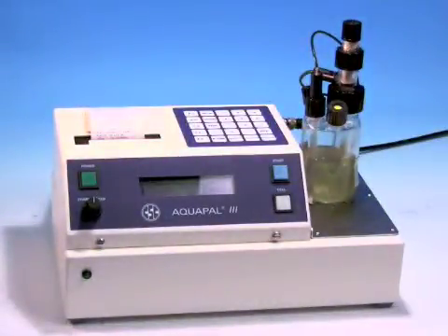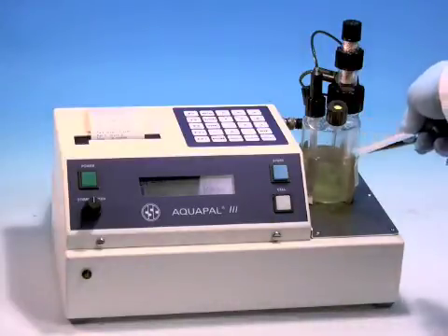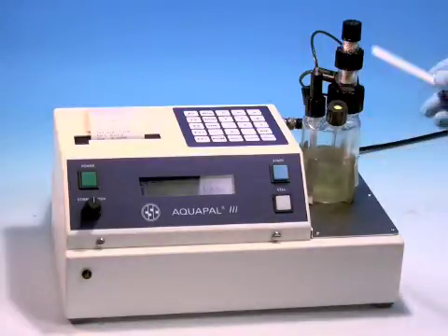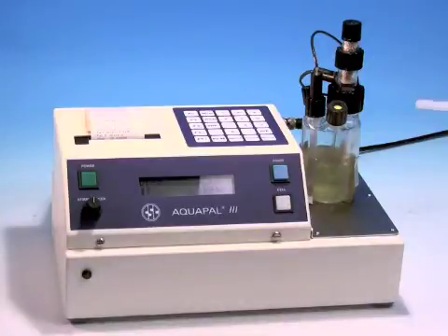This is new, it hasn't been offered before, and the Aquapal is excellent at getting these low-level readings with a single reagent or dual reagent setup. When we talk about single reagent, we're talking about the generator electrode which does not have a frit, does not have a second reagent. That's exactly what this setup has. This is a single reagent coulometric Karl Fischer titrator and we're going to run this standard.